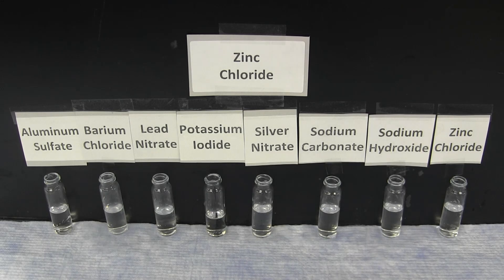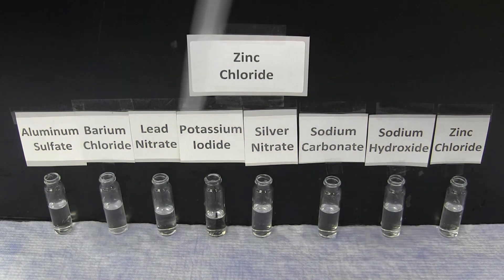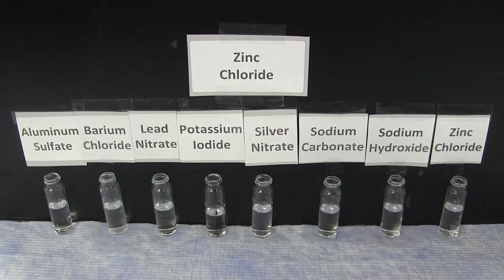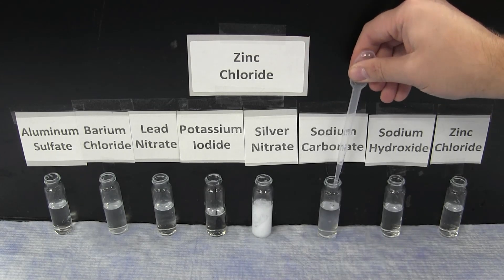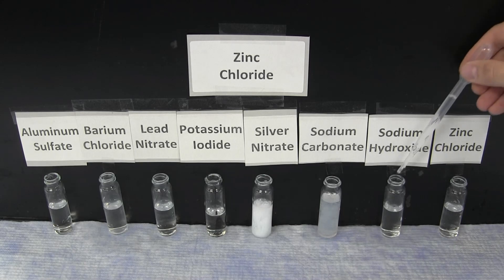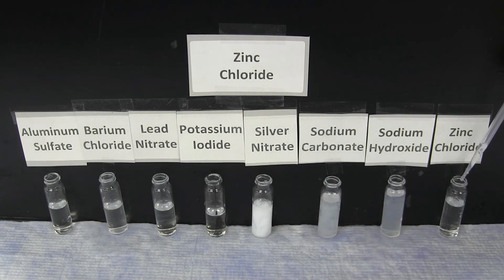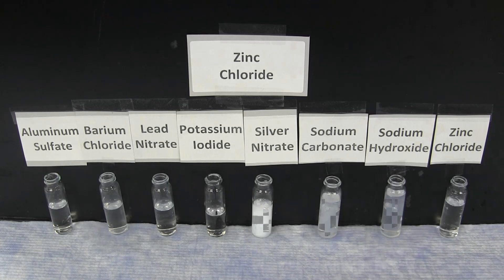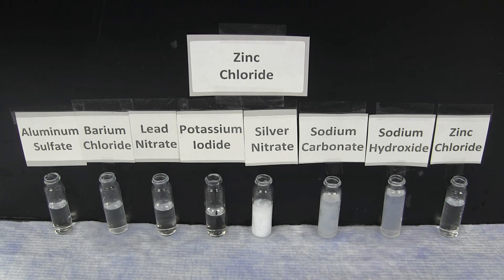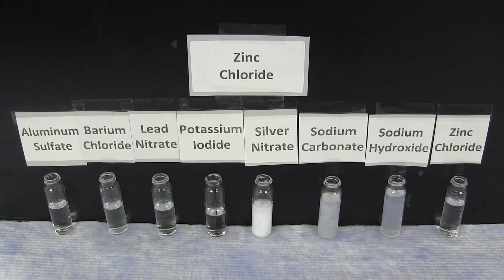The last reaction pattern is that of the zinc chloride solution. The zinc chloride forms a bright white precipitate with silver nitrate, as well as other white precipitates with sodium carbonate and sodium hydroxide. There is no reaction with aluminum sulfate, barium chloride, lead nitrate, potassium iodide, or zinc chloride.